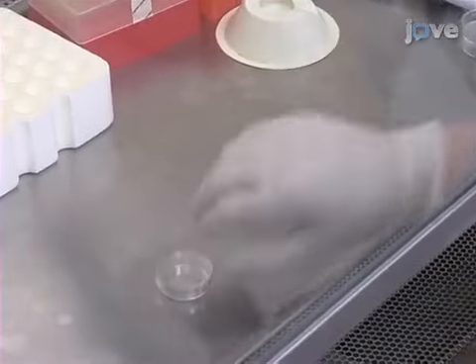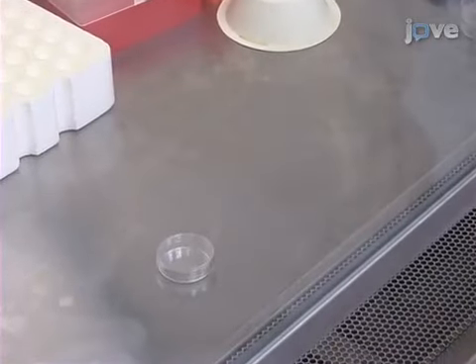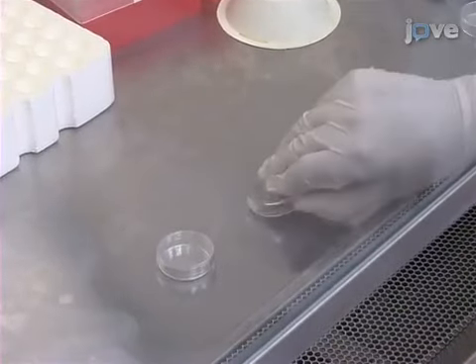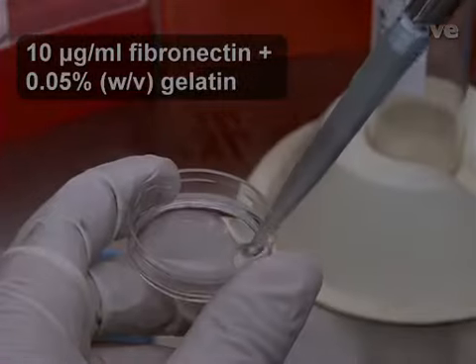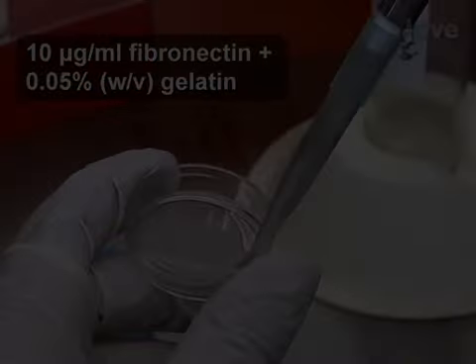To prepare the culture dishes for use in the flow chamber, add one milliliter of a fibronectin solution.